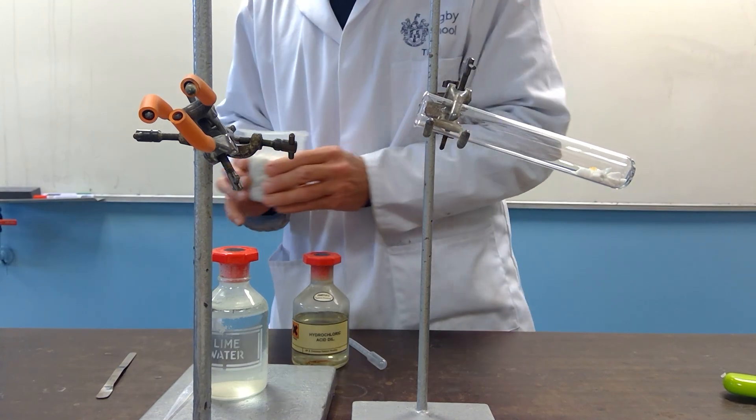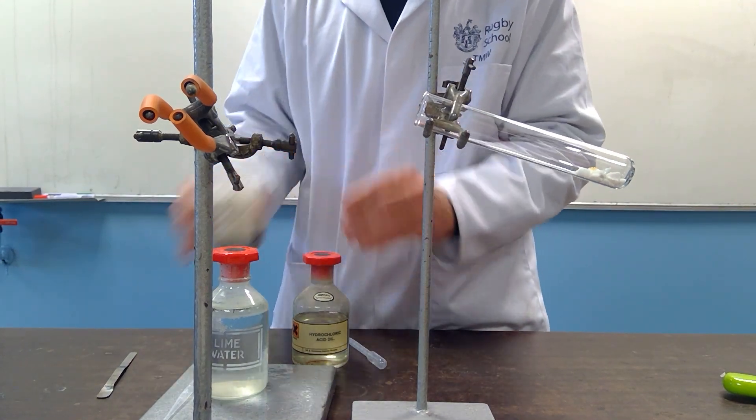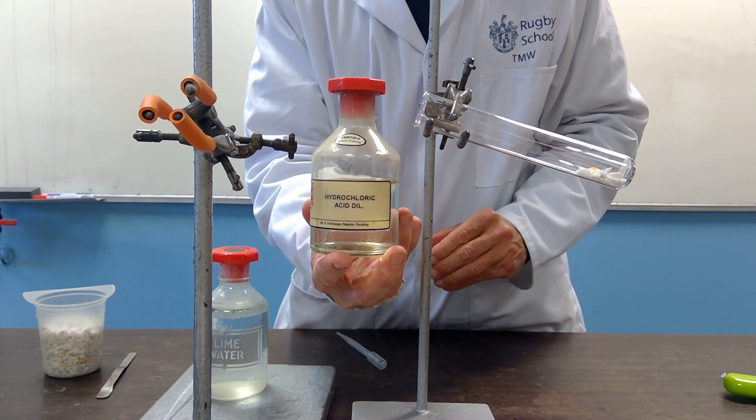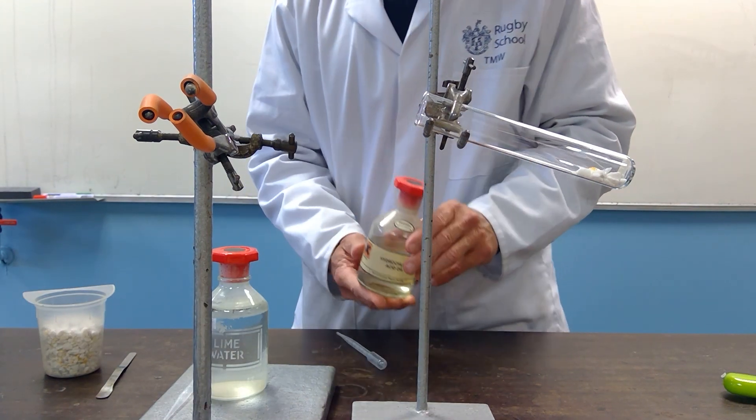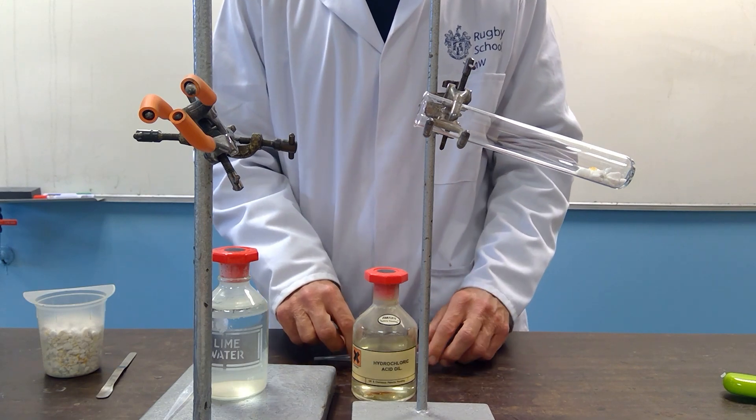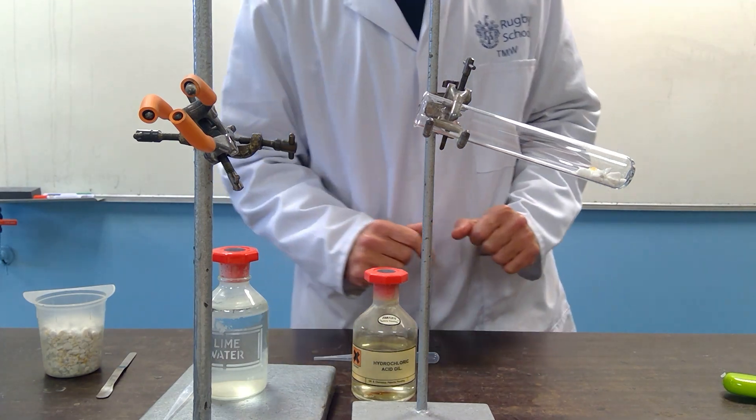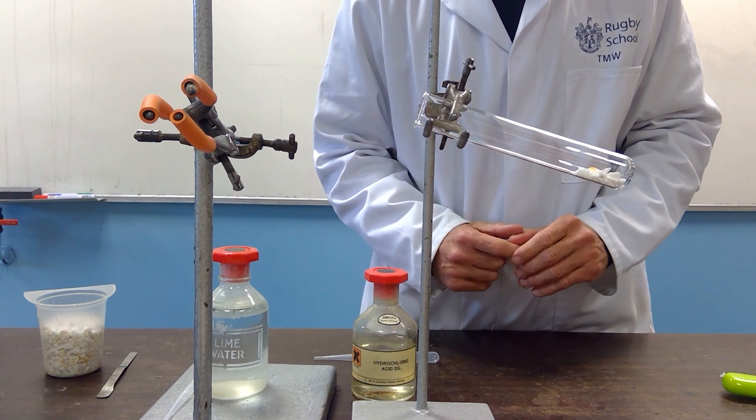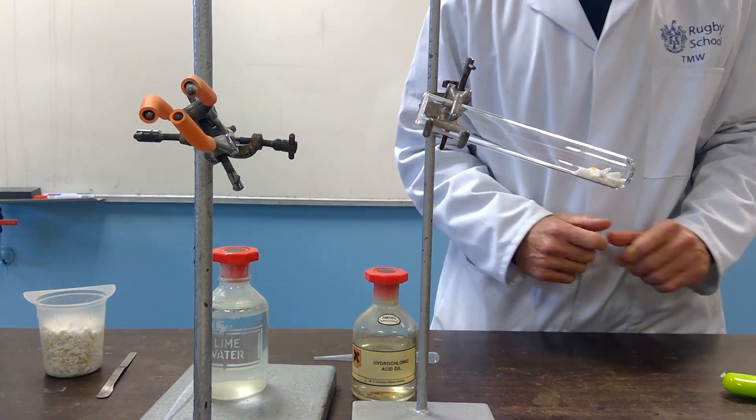And I'm going to add to that, this time we are going to add to the calcium carbonate dilute hydrochloric acid. Acid plus carbonate, acid plus metal carbonate, will always produce a salt, water, but most importantly carbon dioxide gas.